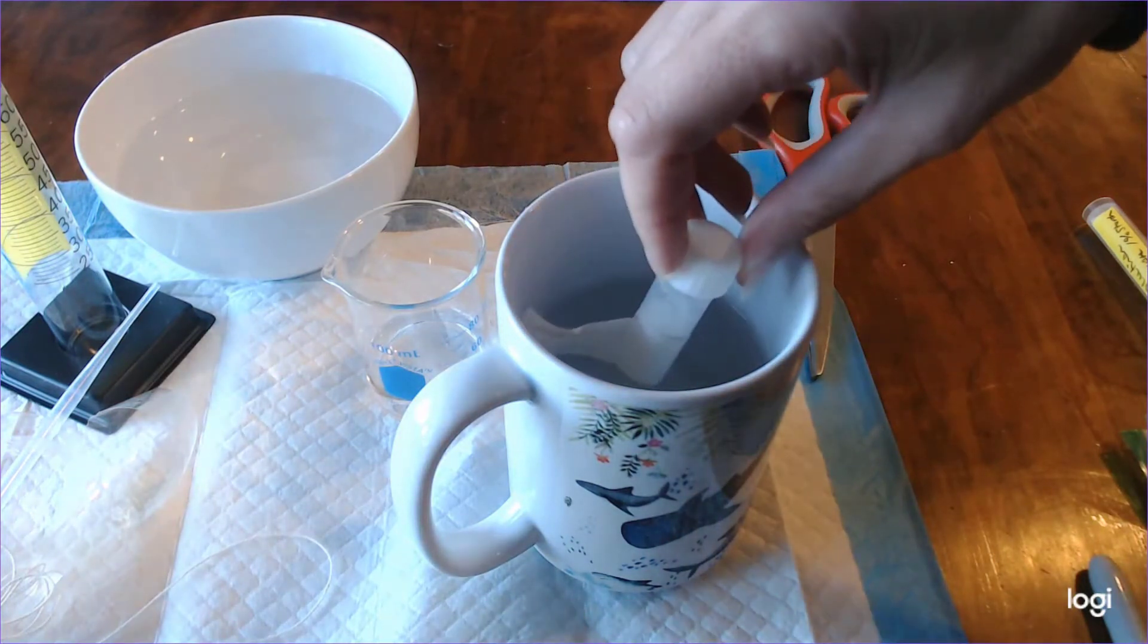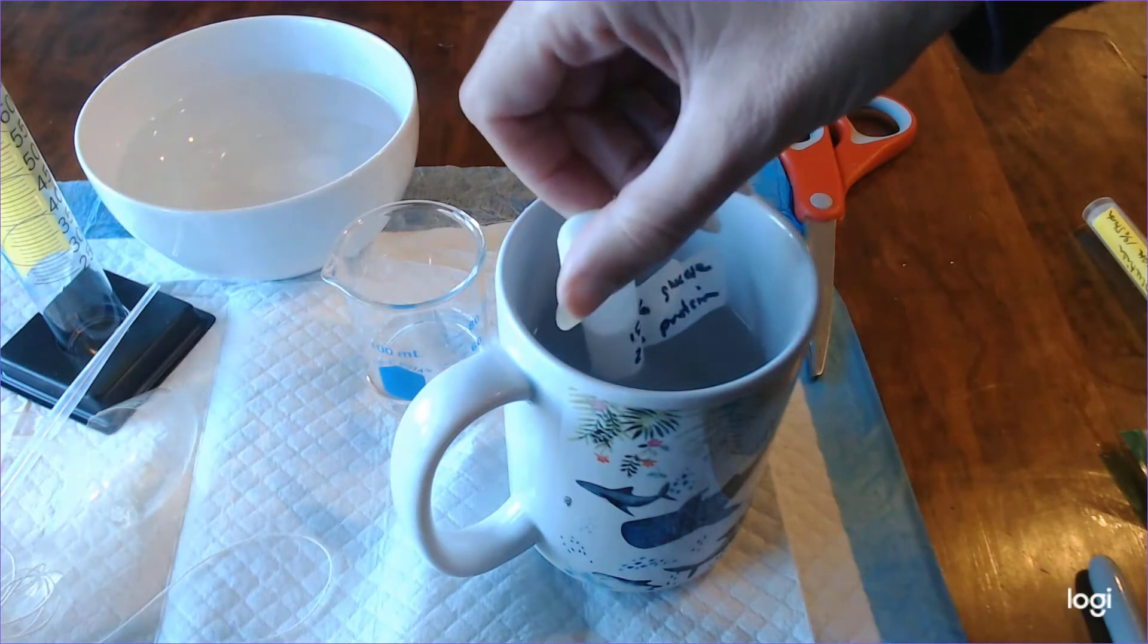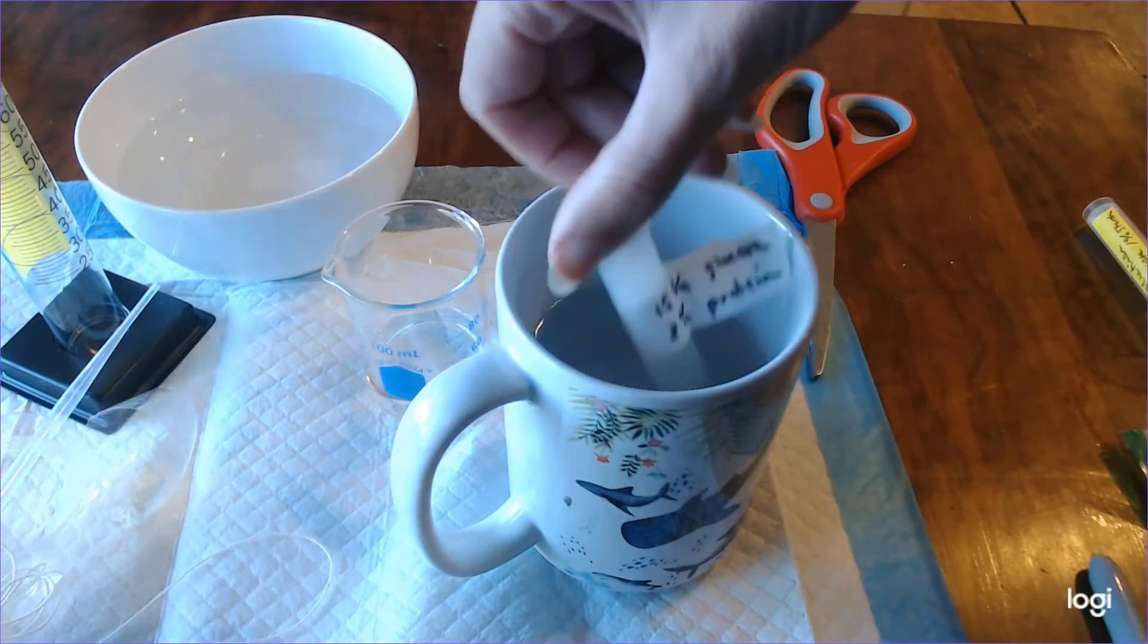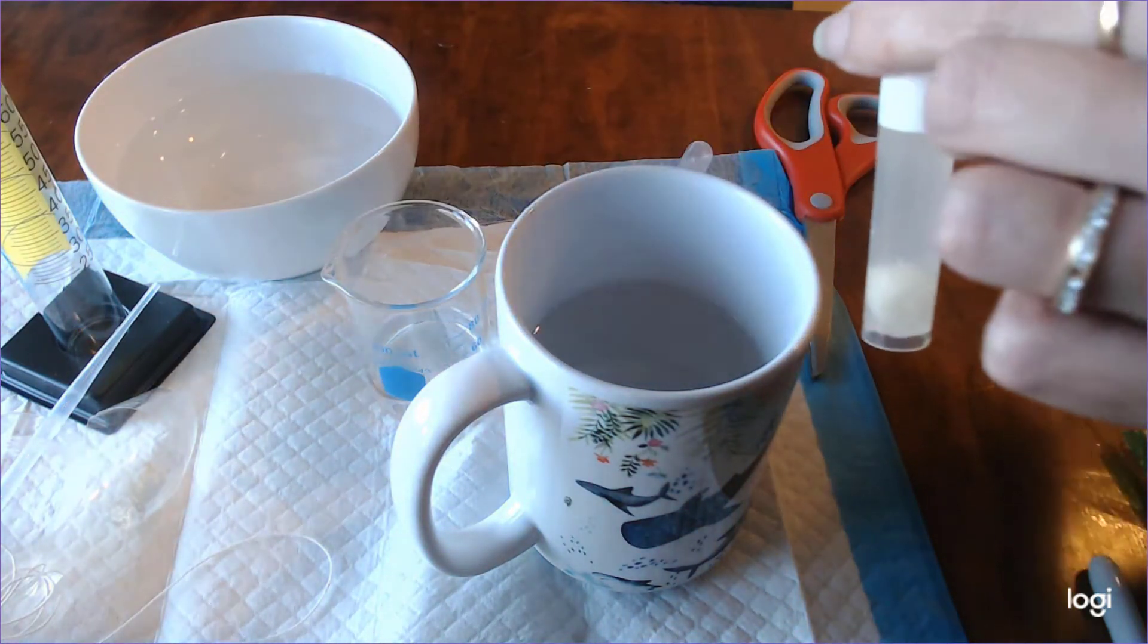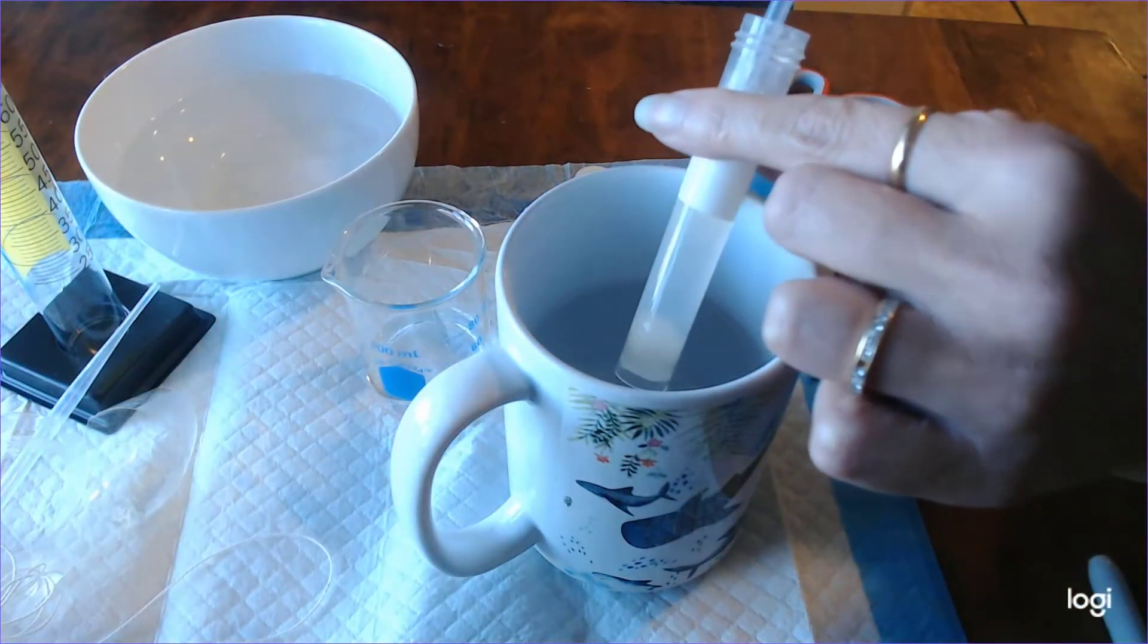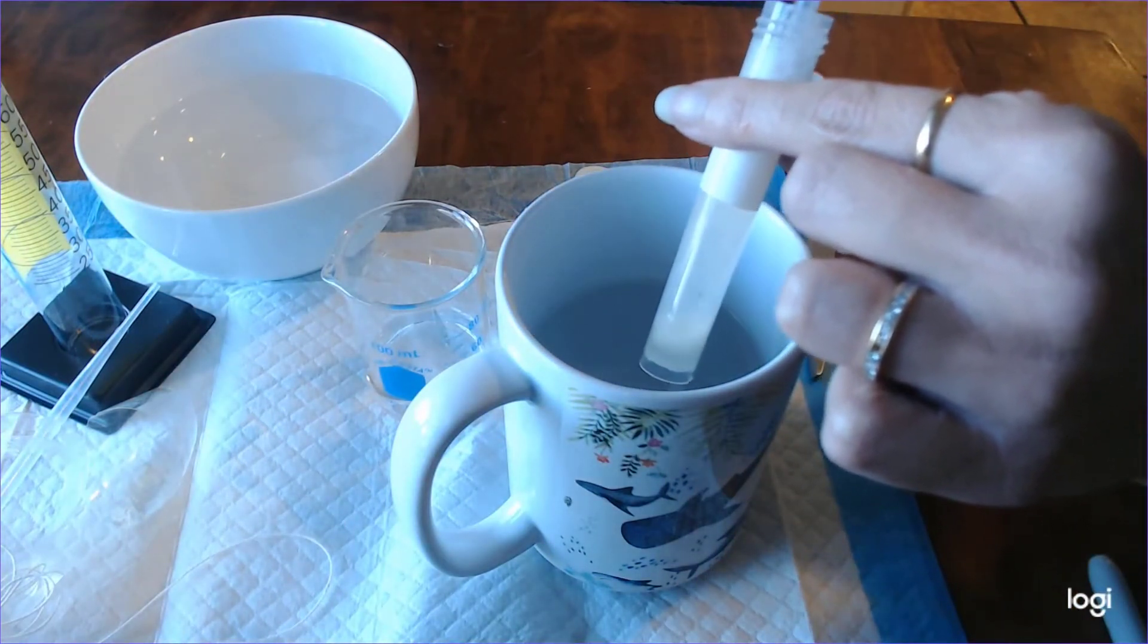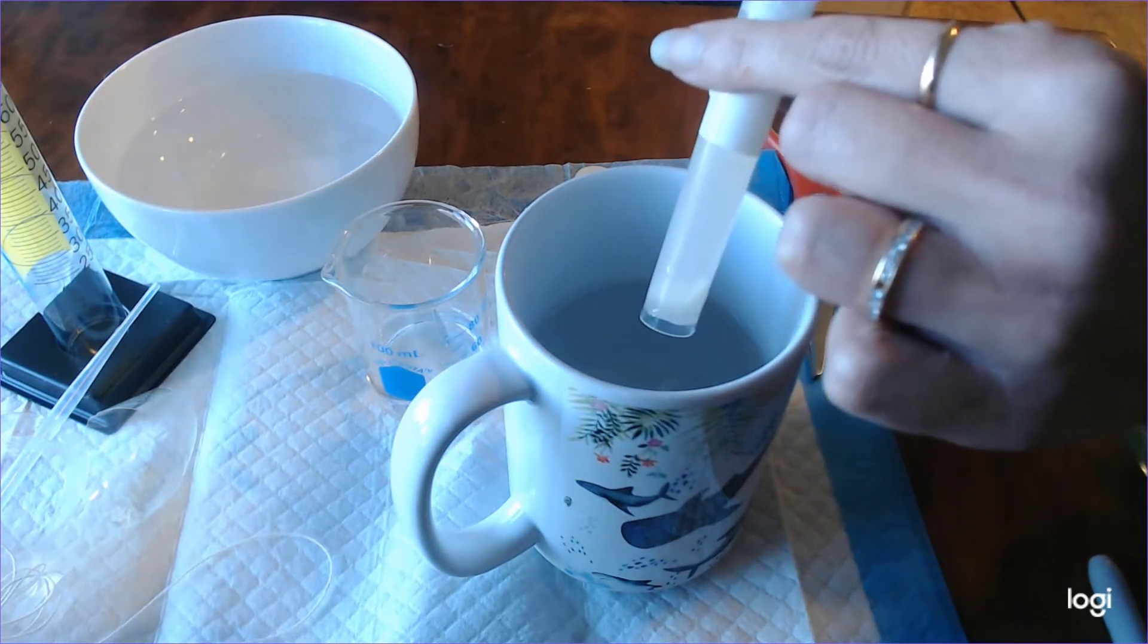So basically it took about five minutes of me putting this test tube in here to get some good dissolution. Now mechanical agitation helped some more, so I still had kind of a chunk at the bottom that was having some difficulty dissolving, so I went back to my little pipette and mechanically agitated it until it dissolved and again the entire process probably took about five minutes.